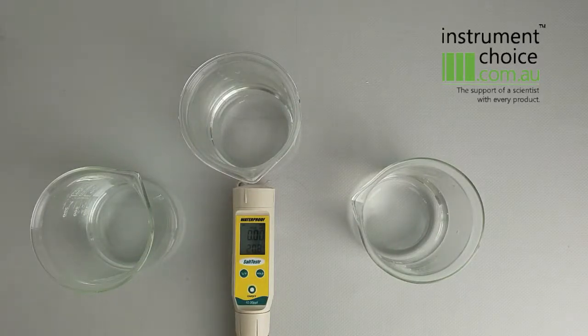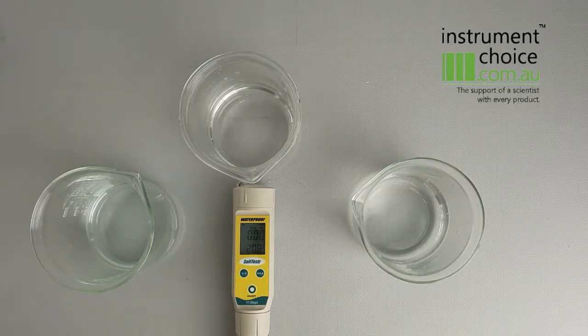Hi guys, it's Daniel from Instrument Choice here. Recently we had an email regarding the EC Salt Tester 11 and how to use it.